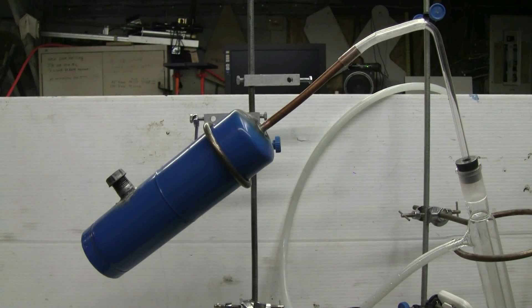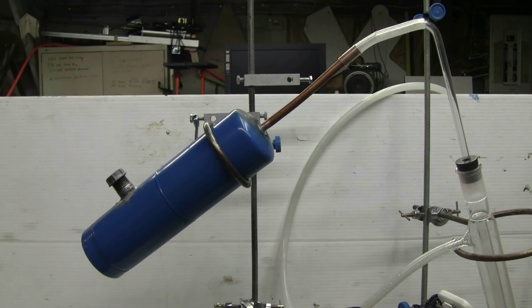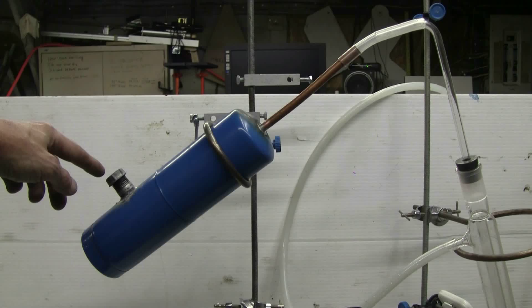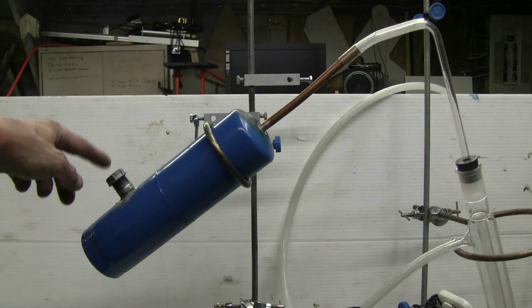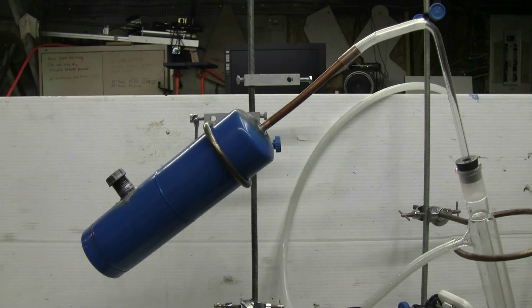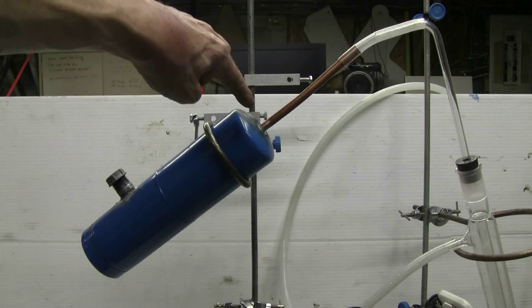To do this reaction, which requires evidently a fair bit of heat to drive, I've made a steel reaction vessel up from an old propane torch tank. I've put a fill for the dry chemicals on the side here with the screw on cap. This is all metal of course because of the heat.